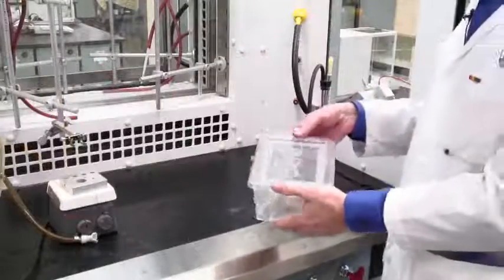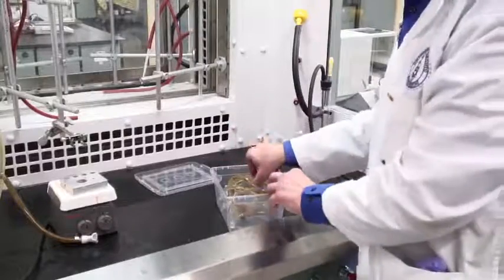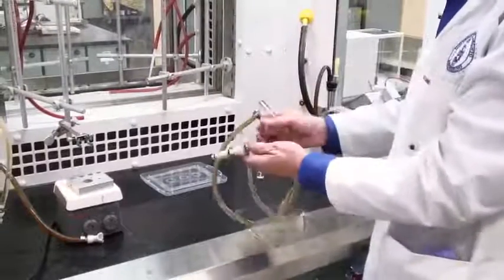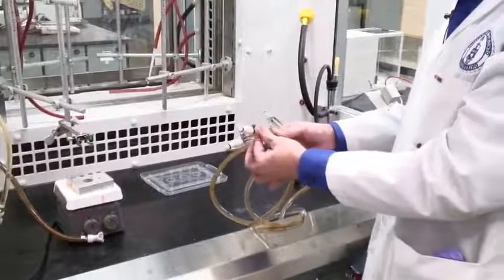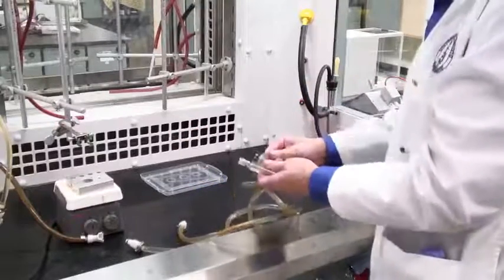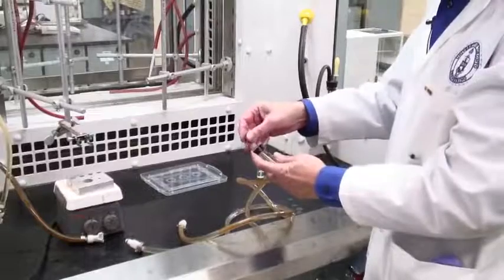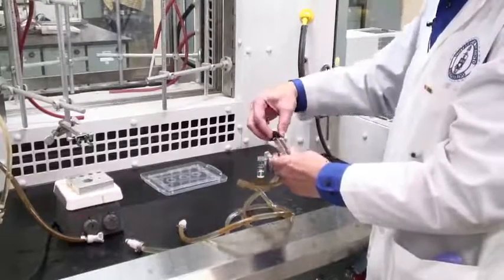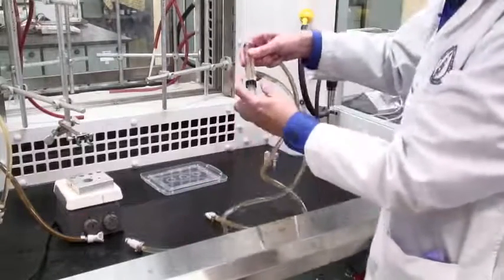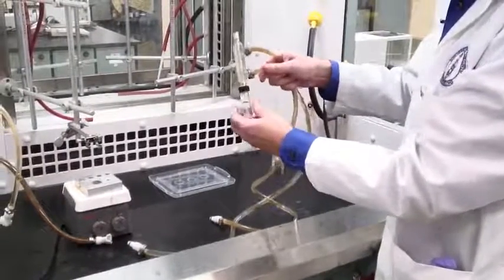You get your water condenser from your TA. It comes in a box, and you will be handing it back in the box to keep it safe. Notice the water condenser has water inside and two nylon connectors at the end of the tubing — these will connect to the plumbing later on. Just like the air condenser, first put the threaded collar over the lower joint, then roll on an O-ring. Take your reaction vessel and connect the condenser, then tighten the screw thread.